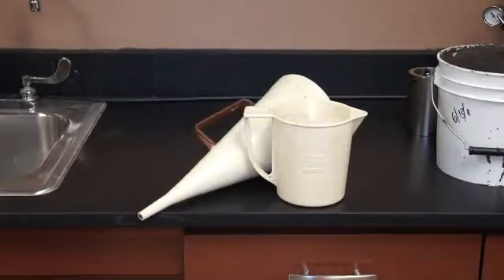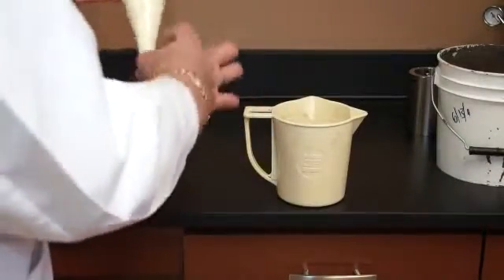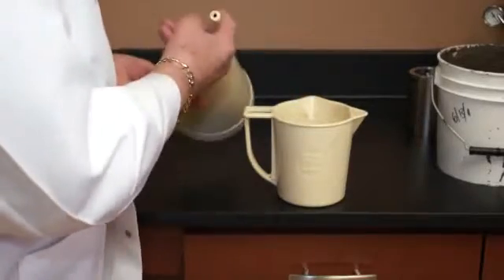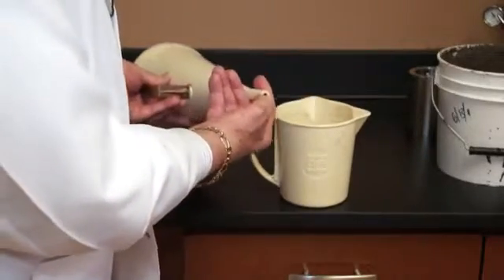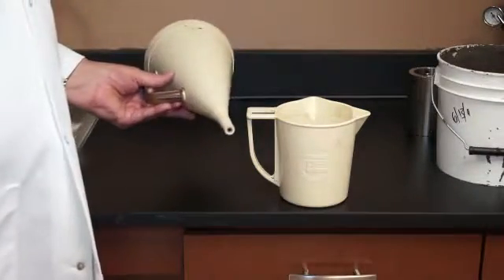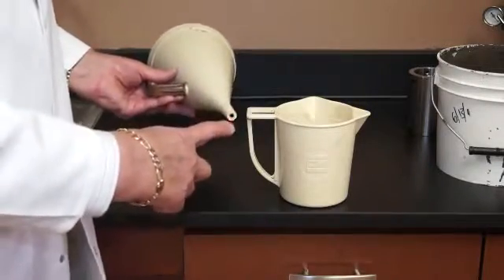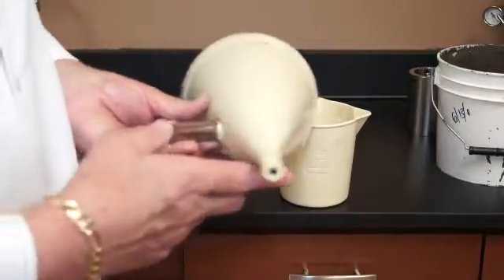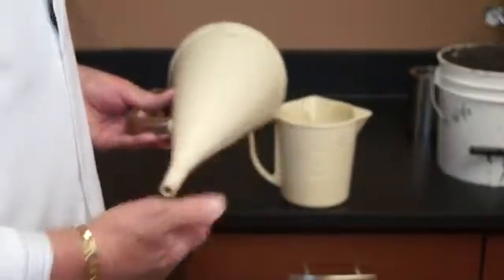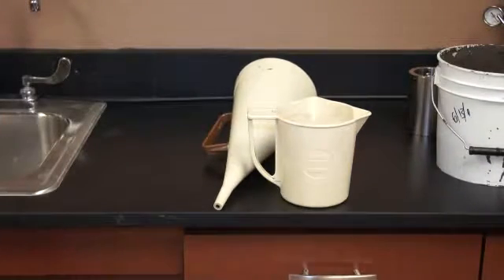The opening at the bottom, the orifice down here, is 2 inches by 0.185 inches. There is a metal insert in here. If this metal insert gets lost, you need to throw the funnel away and order another $20 Marsh funnel. Now, they're not expensive, but this is very important. This has to be of a set size. There's an insert in the end of the funnel there, so it's important that that insert remain in place.